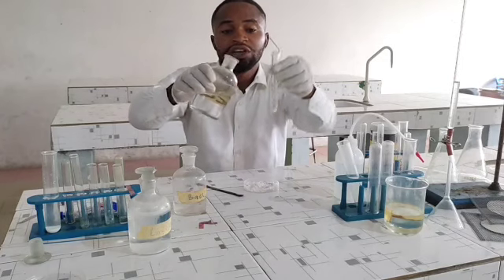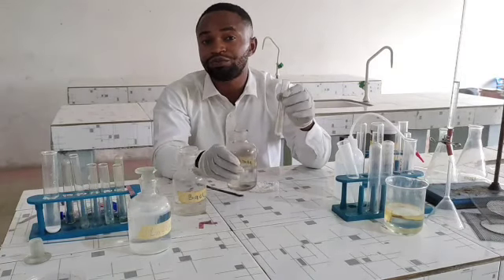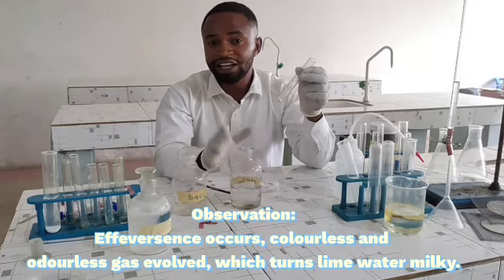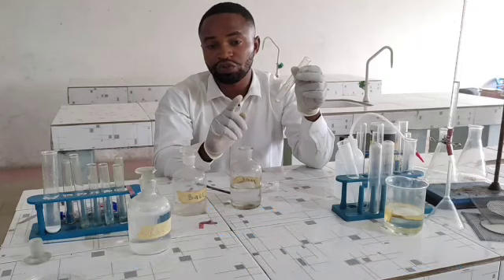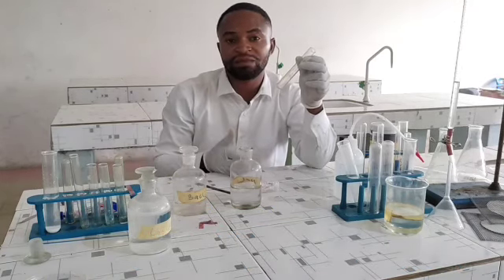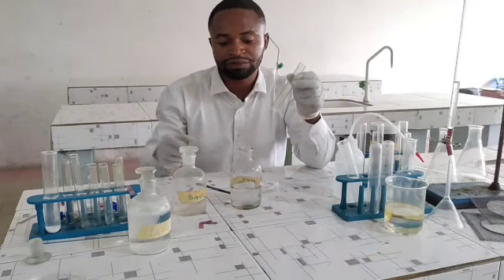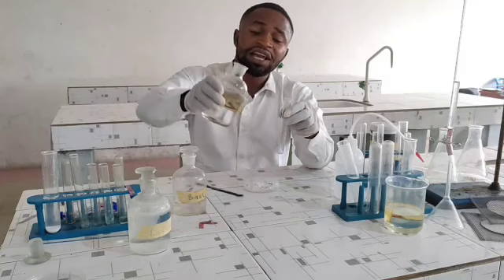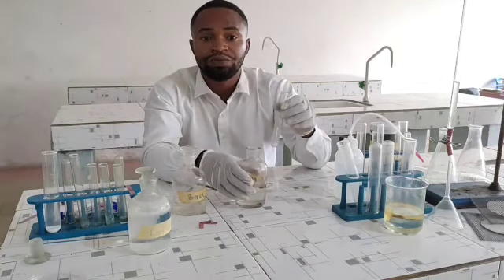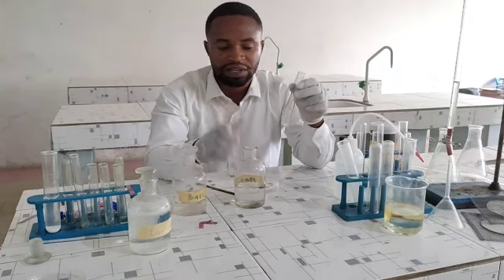Please observe what happens. Effervescence is going to occur. A colorless and odorless gas is going to be released. Why do you think effervescence will occur? At the end of the day, you should be able to answer questions like why the tiles in your chemistry laboratory are not made of marble, which is calcium carbonate. Now, observe what happens. Immediately I add this acid, effervescence is going to occur. A colorless and odorless gas is going to be released, and that gas can turn lime water milky. Now, let's confirm that.